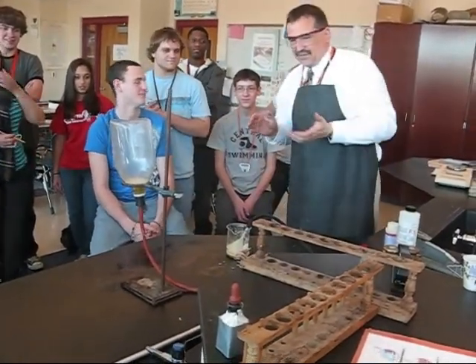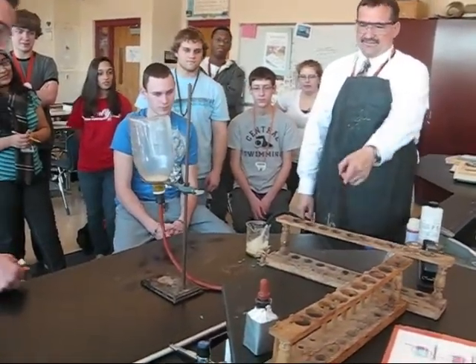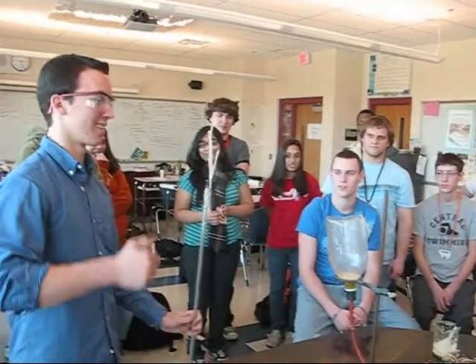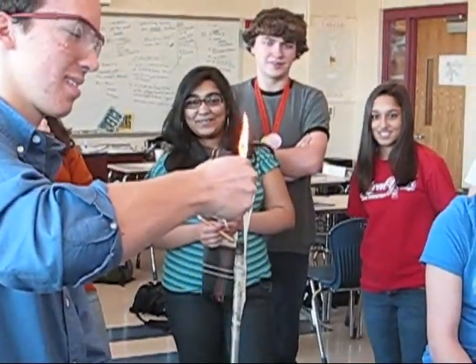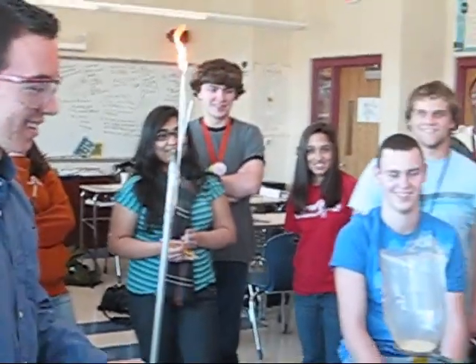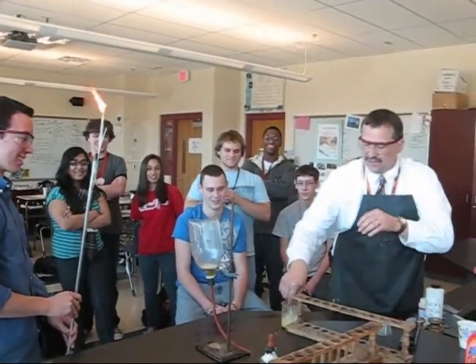Here's your job. Are you ready for this? You take the burning torch — it's not burning yet, we'll fix it. See that stuff on the end? That's flammable. Light it. Now the people are watching. When the bubble gets up and away from the instructor, touch it with the flame and see if we can see a chemical change of methane.